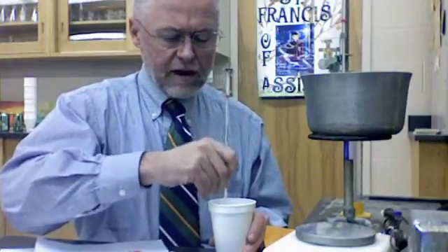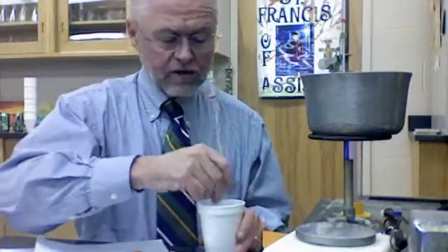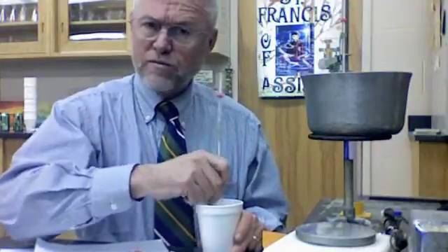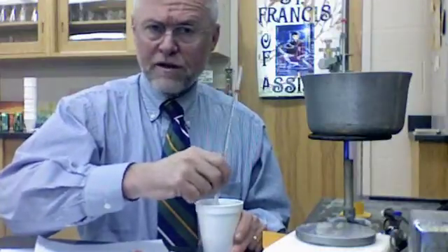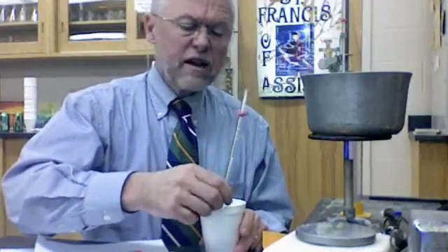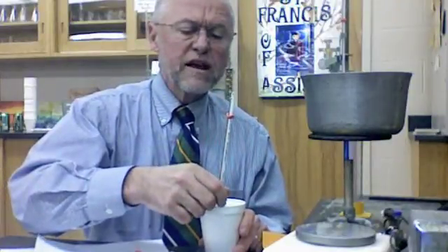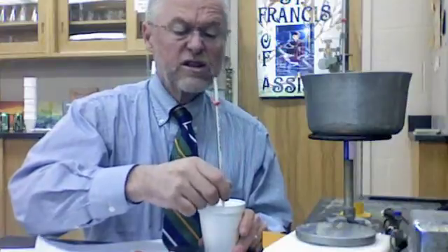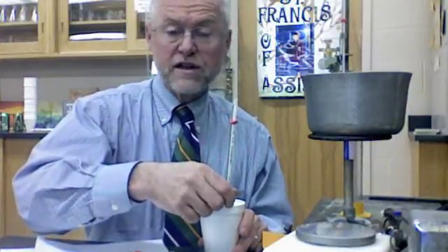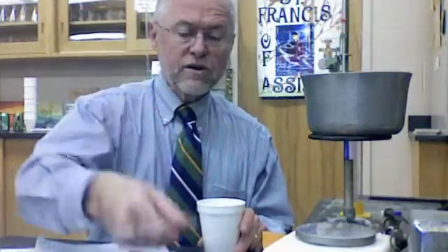Now, the metal weighs probably about as much as the water. So which one do you think is going to go up the most? Or maybe you think one will go up more than the other. Well, let's see. As soon as the temperature quits going up, and it looks to me like it's pretty much done going up here now. It doesn't take very long. It's 31 degrees Celsius. So 31 degrees Celsius goes under the final temperature of the metal and the final temperature of the water. It goes in two places because that's the final temperature of the metal and of the water.